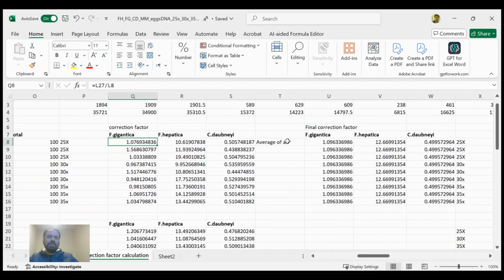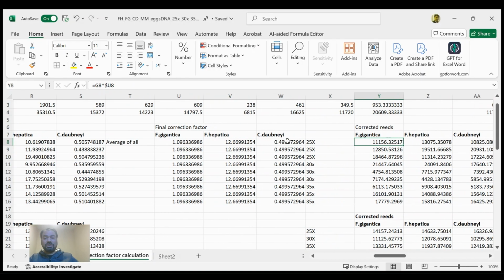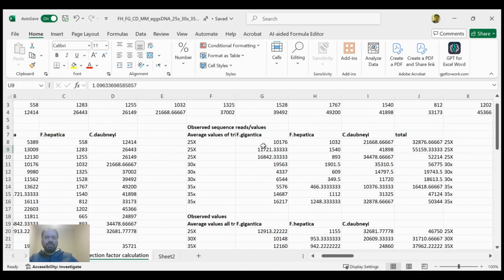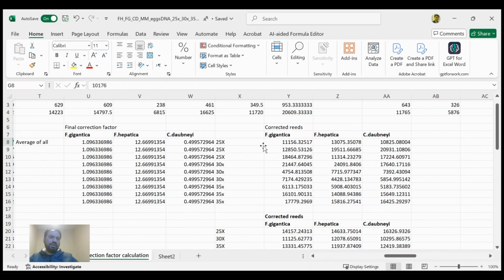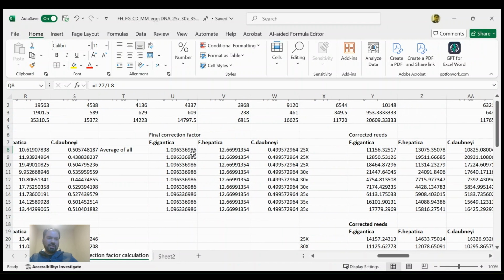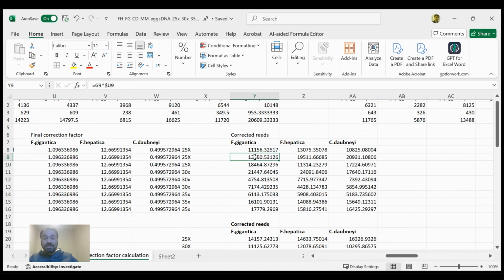And after calculating the correction factor, now we are normalizing the data that we have observed initially. In normalizing the data, we have just multiplied the correction factor with the actual number of reads. Here you can see the actual number of reads. These are multiplied with the correction factors. Here we have written the correction factor as we have calculated by dividing the actual percentages over the observed percentages of the reads. So after multiplying with this correction factor, we got the number of reads which were bias free.